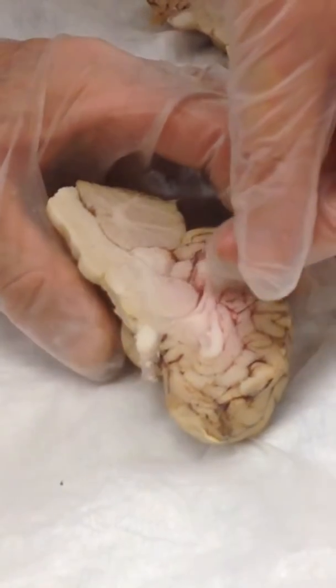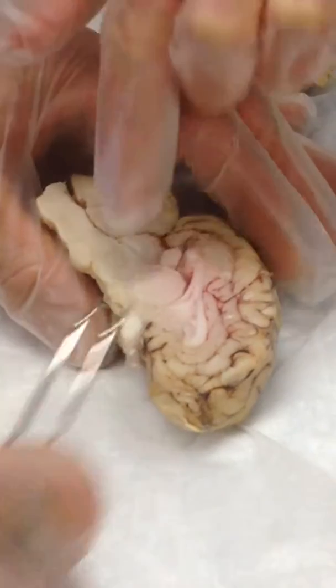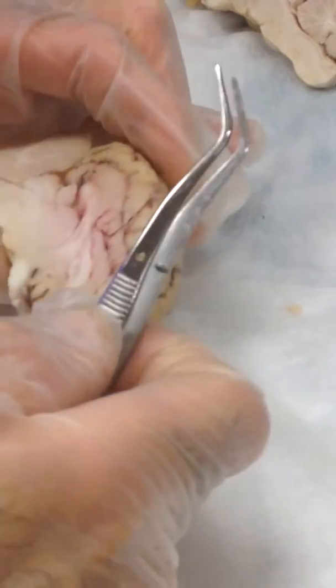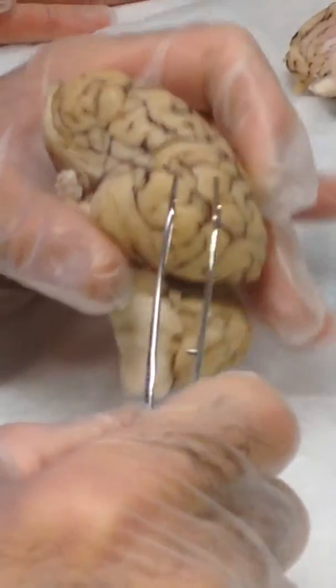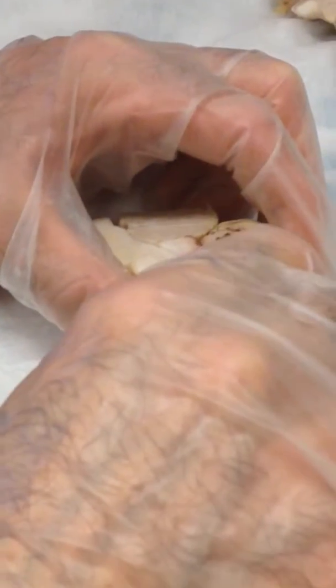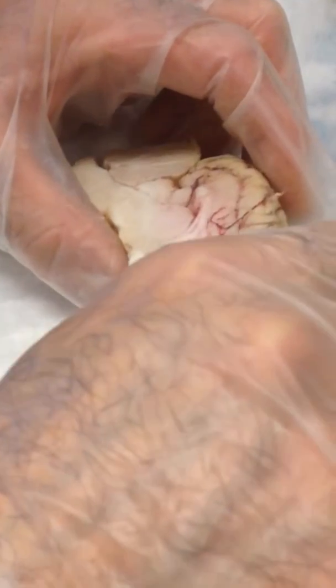So this white part, the fornix, did you say? Fornix. Does it continue behind that membrane? No. So this is going from the hippocampus. The hippocampus, remember, this is the hippocampal gyrus, so it's sitting in here. It's not a midline structure. Its fibers come from behind there on its way to the mammillary body. No, it stays pretty much on the surface here. Okay. We'll dissect that out, actually.